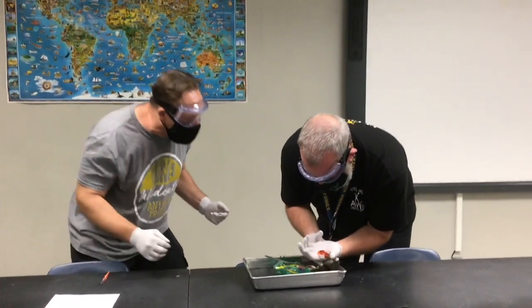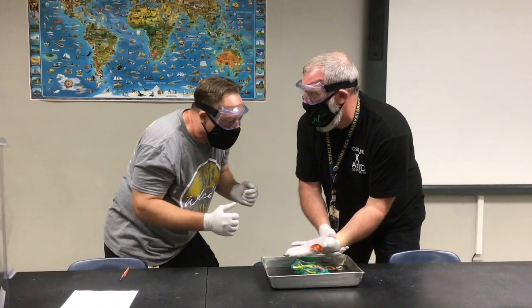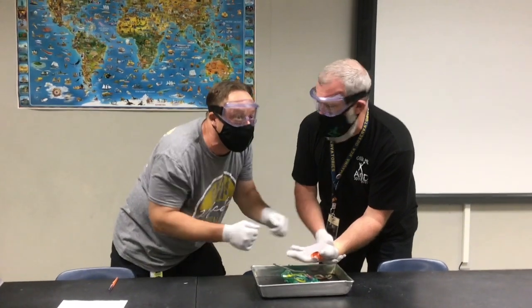Oh my gosh! Oh my gosh! Dude, we can't tell the teacher. We're getting in so much trouble. What do we do? Just go wash it off. Okay, okay. Don't tell anybody.